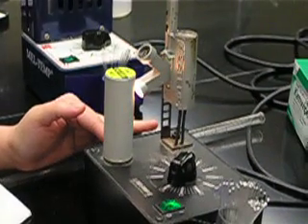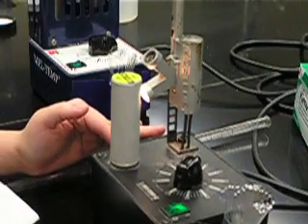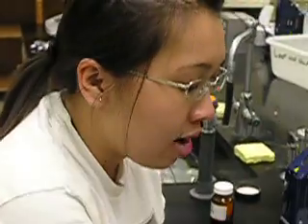And then take a second temperature when your sample has completely melted. And those two samples should give you your melt temp range for your product.